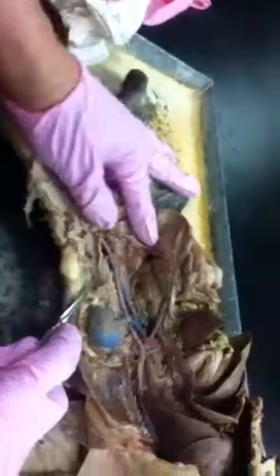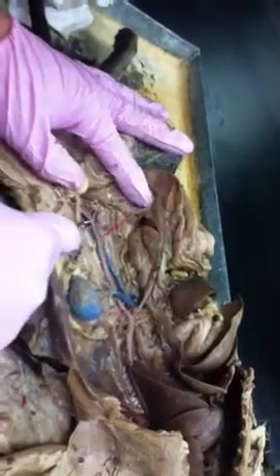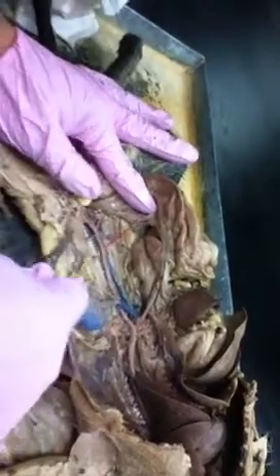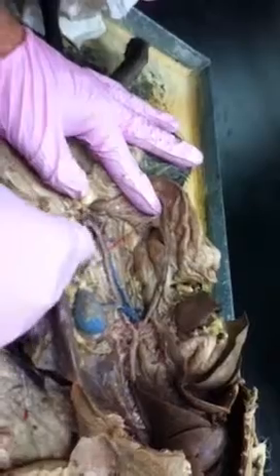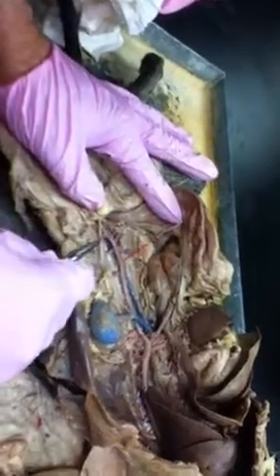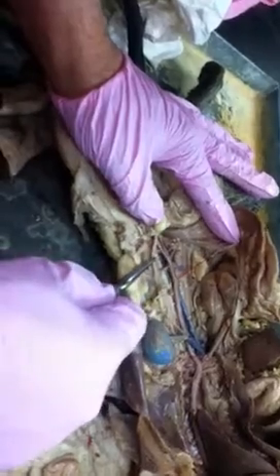Adrenal, lumbar arteries. But here I really do like, and I usually use a picture, but this is a great picture of this aorta branching off into external and then internal iliac arteries. You can really see that well here. You can see it in the book, but I don't know if I've ever seen it quite as well as here. So that one I may actually use.